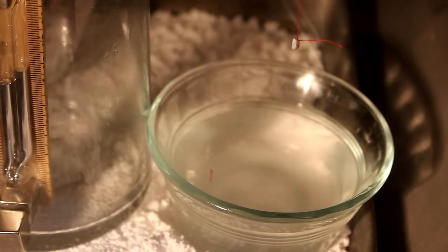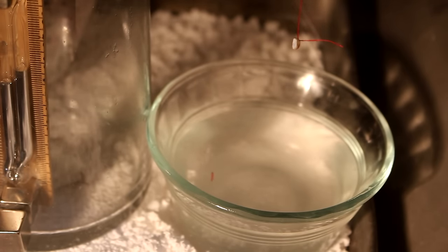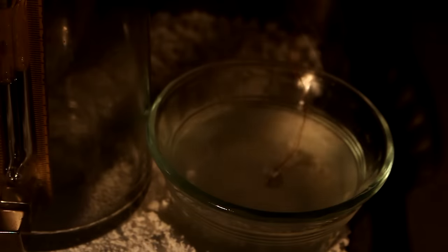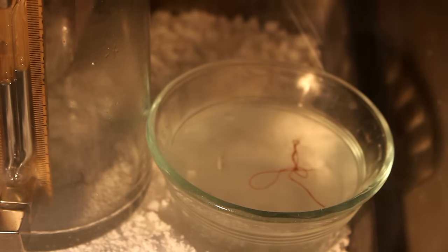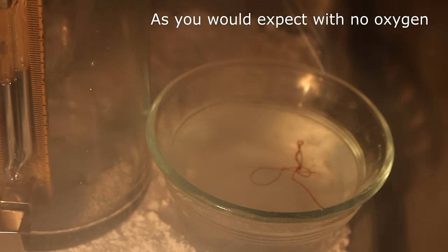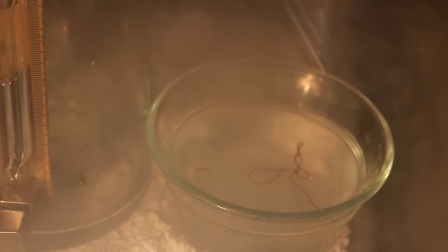Once again at low pressure. Let's cut the string. And watch it. Definitely does not ignite. And jumps around a lot more. Interesting.